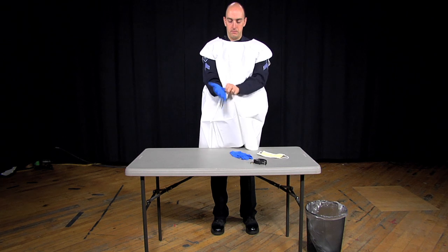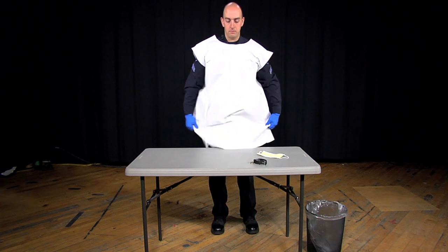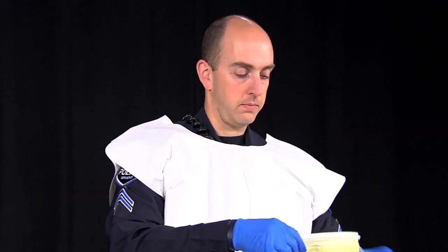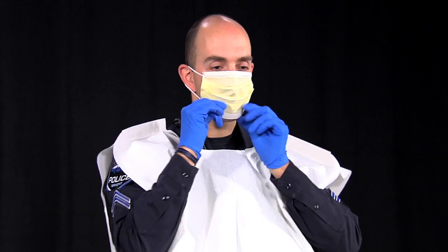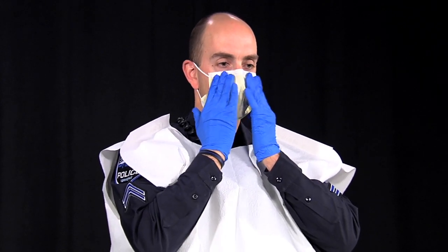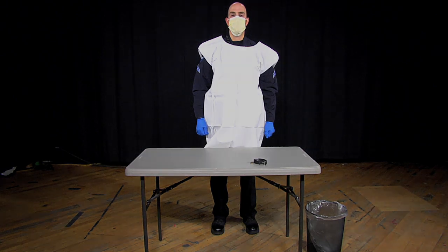Put on your gloves, ensuring that they are the correct size and that they fit snug on your hands. Put the mask on your face with the wire nose piece at the bridge of your nose. Slip the loops over your ears and adjust the nose piece to fit the mask snug to your face. A mask will protect you from inhaling the drug through your nose and mouth. You have now finished donning your PPE and are ready for testing.